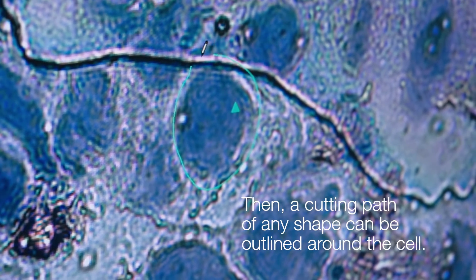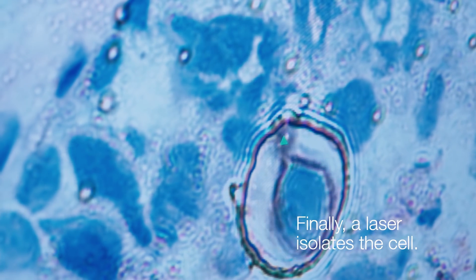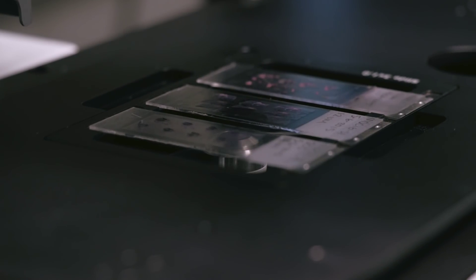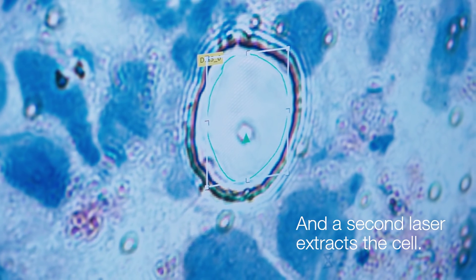Anna is going to use this one micron UV laser to cut around a cell and then use another laser to burst that cell out of the tissue and into a collection vessel.